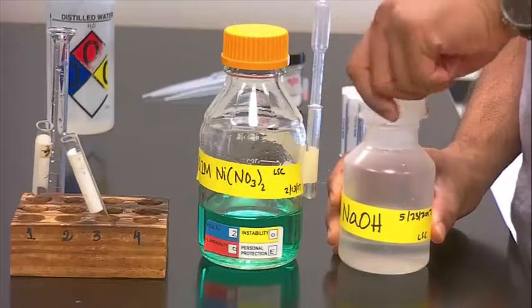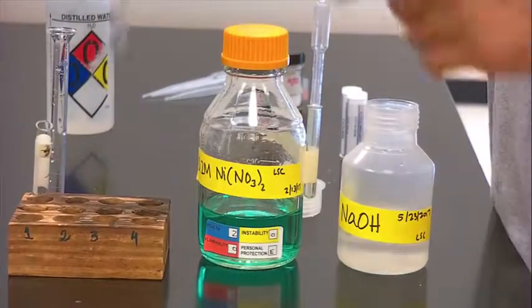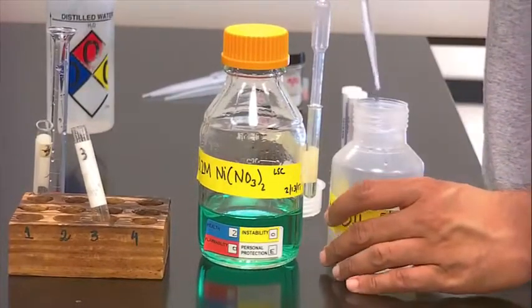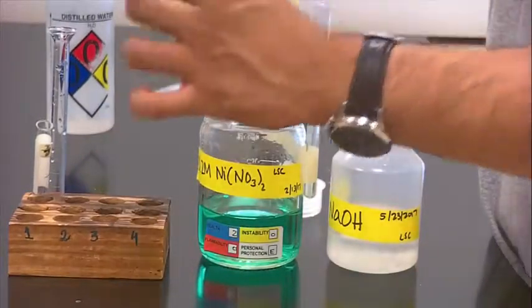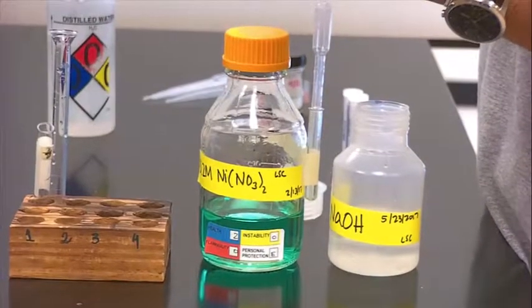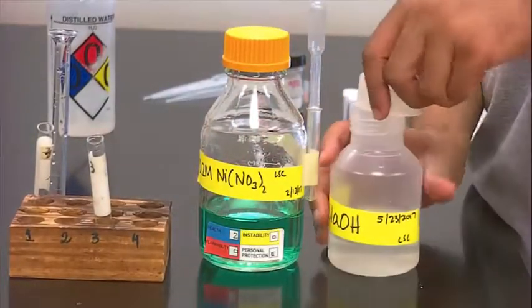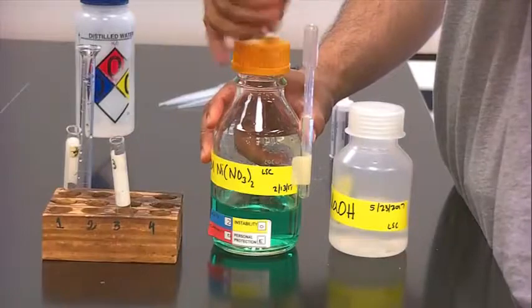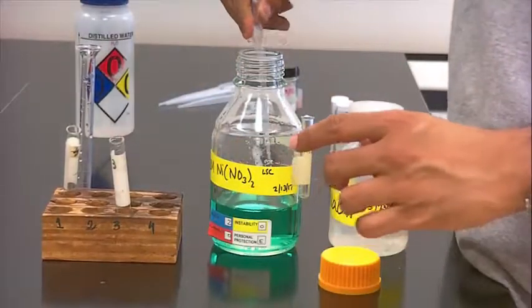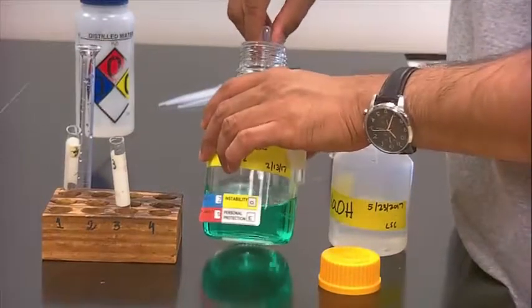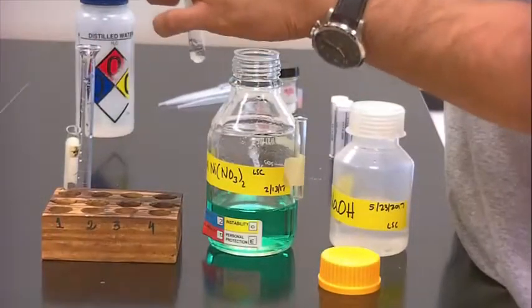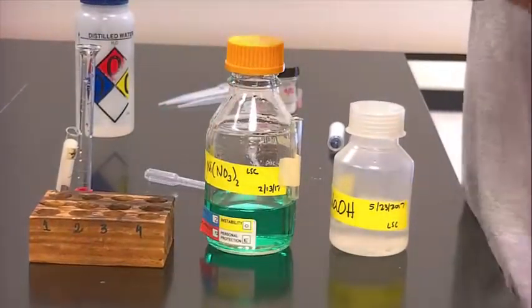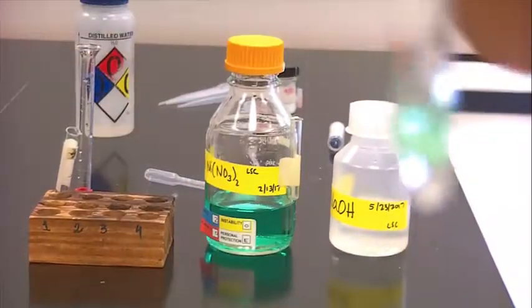Let's do this experiment here. I already got my 1 mil line and my second 1 mil line that I measured with a pencil. I'll put 2 molar sodium hydroxide here up to that line. Then I will react that with the 0.2 molar of nickel nitrate.